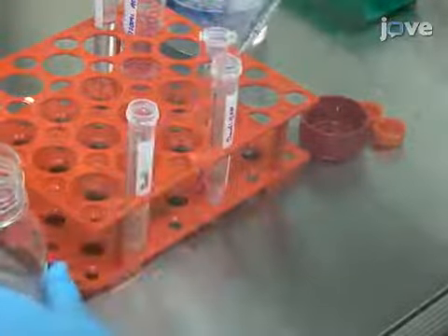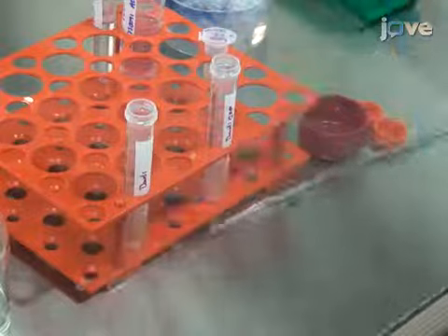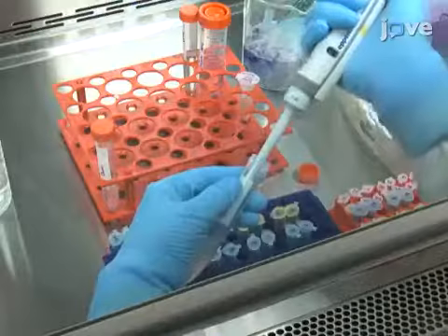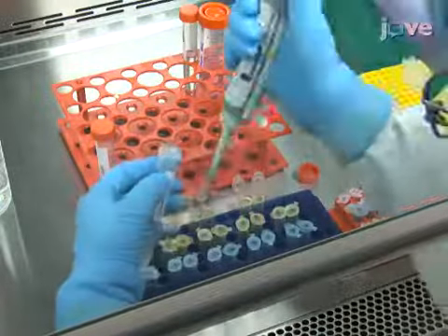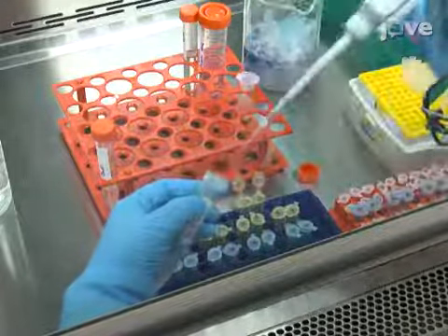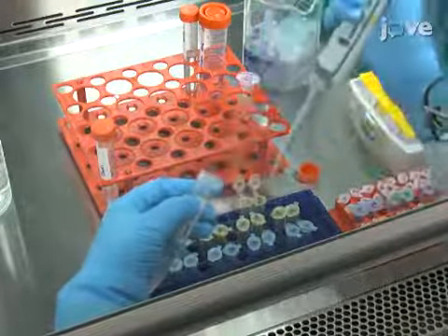If the cultures are 95% viable or greater, dilute the cell suspensions to a 4 × 10⁶ cells per milliliter concentration in cold staining buffer, and aliquot 50 microliters of cells into individual 1.5 milliliter microcentrifuge tubes containing 100 microliters of at least 5 different concentrations of the reference or biosimilar monoclonal antibodies.